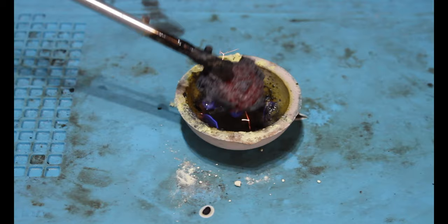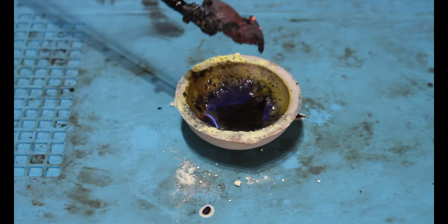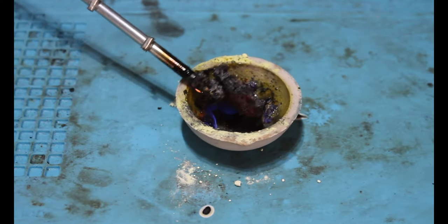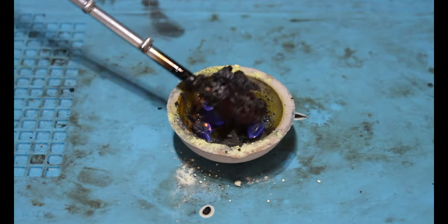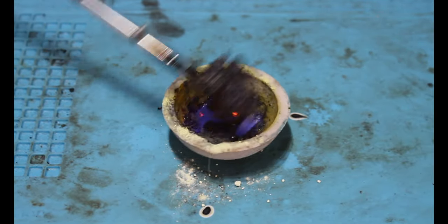And there we have it. There is our compound of iron and sulfur. But let's have a bit of a look at what's going on chemically in this reaction.